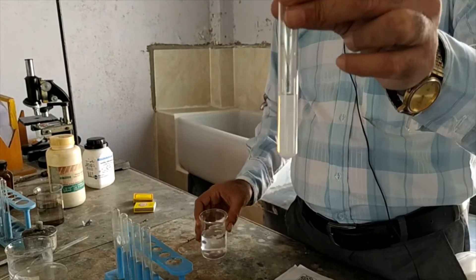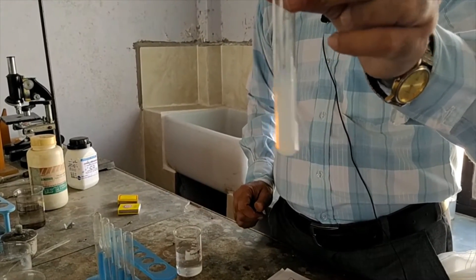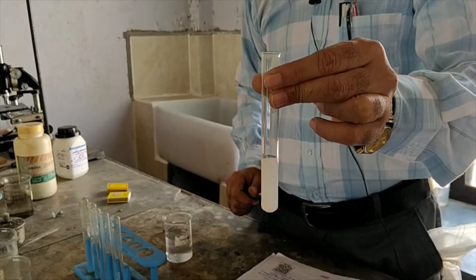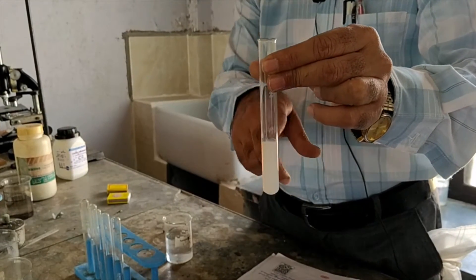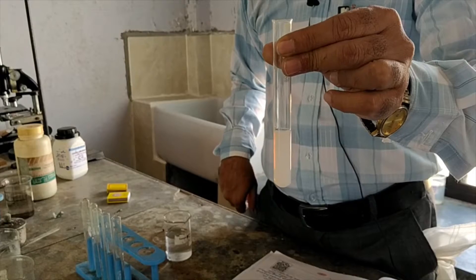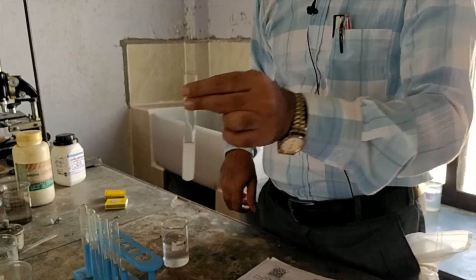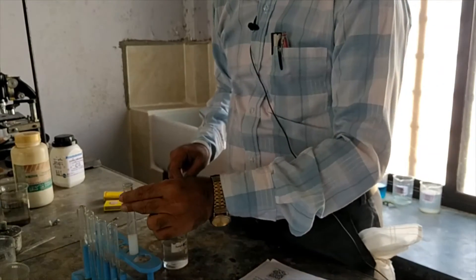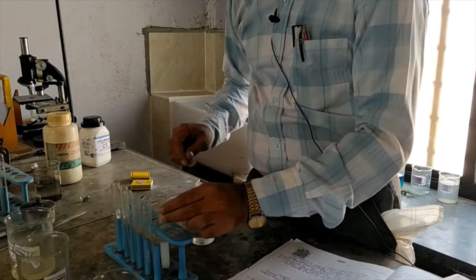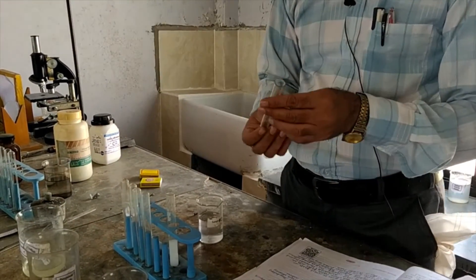Now observe the colour change. Can you see the colour change? See here — the colour is white. I will keep this test tube here and give you the final conclusion afterwards.